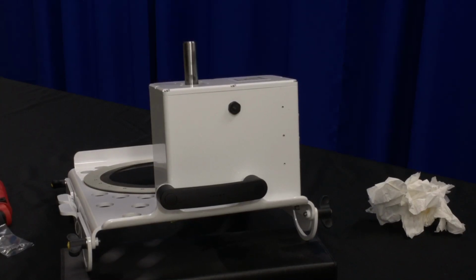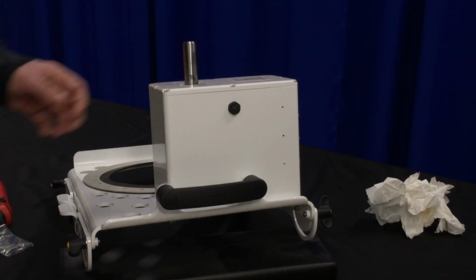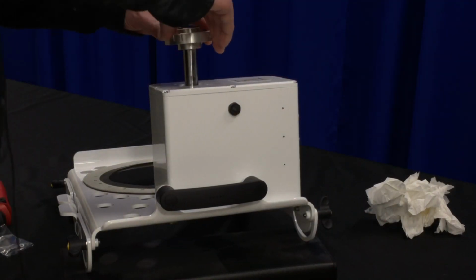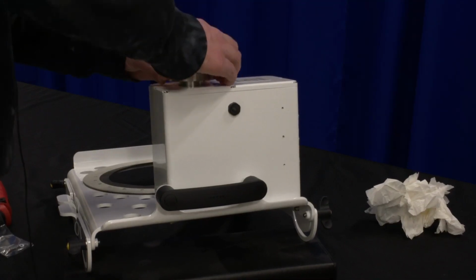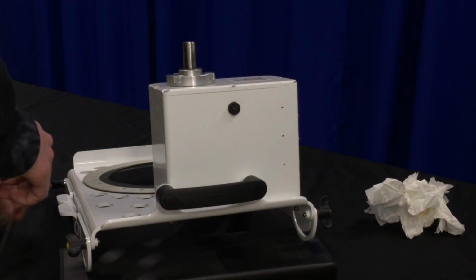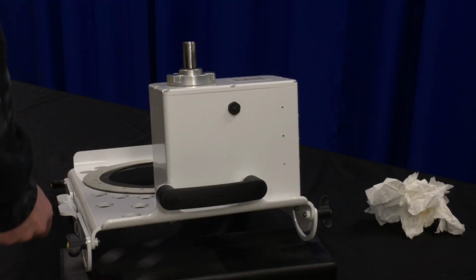Next step is to install the new shaft seal assembly. Be sure to clean the surface if it needs it. All we need to do is slide it on first and then just line up the holes. There are 4 screws and flat washers. They're all the same.